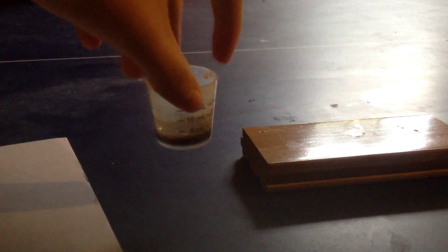What I've got here is some rather impure magnetite. It's probably tainted with iron-3-hydroxide like this orange patch on top, but you can see it's dark brownish because it's well mixed.